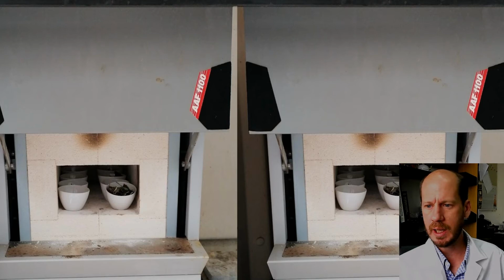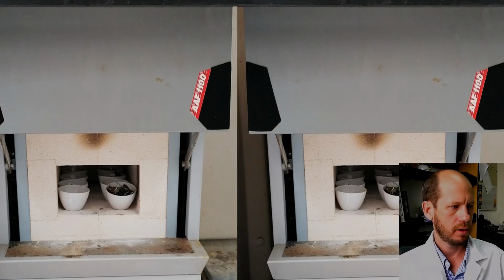So how do we do this analysis? We chose one method of digesting this plant material. Actually, what we're doing now is only ashing the material on the furnace. So we set up after we measure the dry weight. For the last practical, we said we use data of fresh weight and dry weight, and now we are taking the same plant material that we use for dry weight, and we are burning it up on the furnace, and this is how it looks like on the furnace.